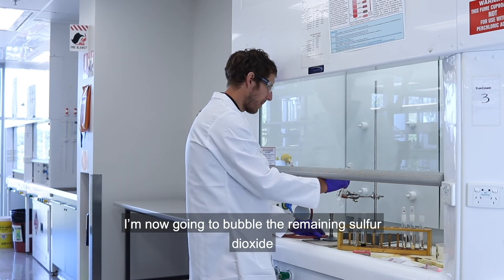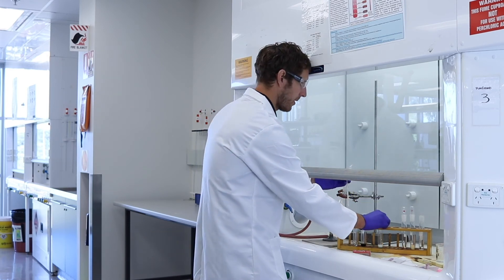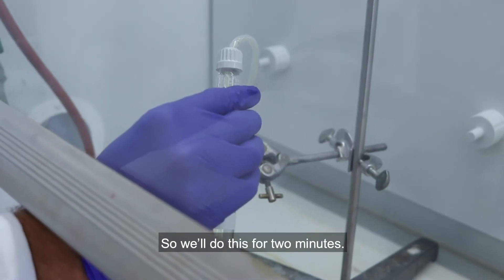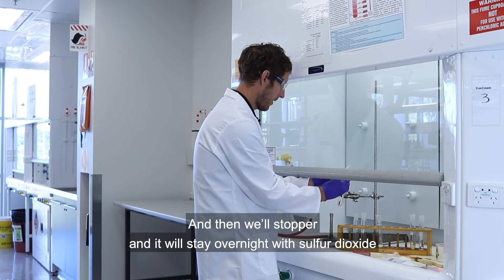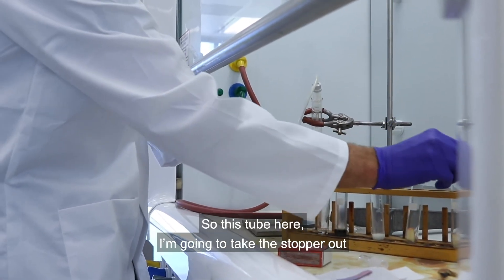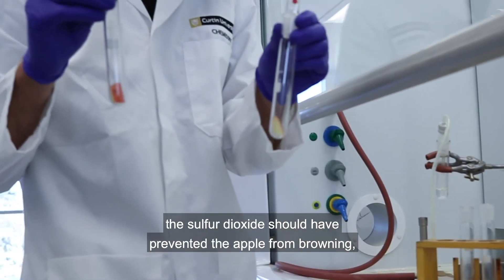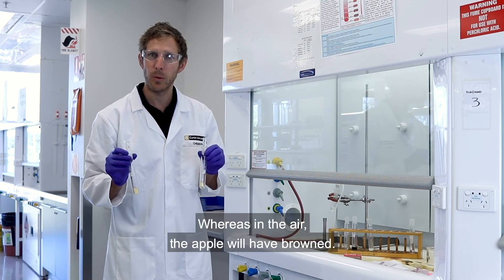I'm now going to bubble the remaining sulfur dioxide through one of the tubes of apples. It will stay overnight with sulfur dioxide in the tube instead of air. We'll do this for two minutes and then stopper it. This other tube here — I'm going to take the stopper out and leave it open. When we come back tomorrow, 24 hours later, the sulfur dioxide should have prevented the apple from browning, whereas in air the apple will have browned.